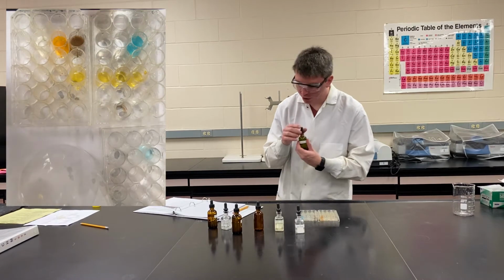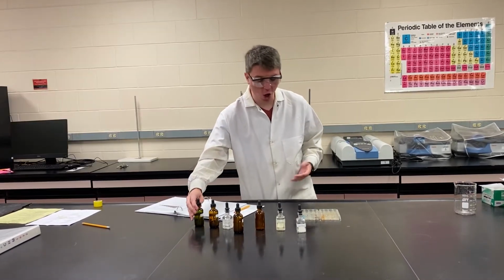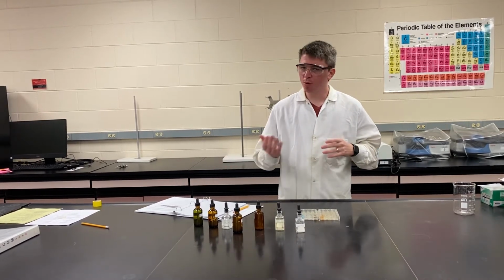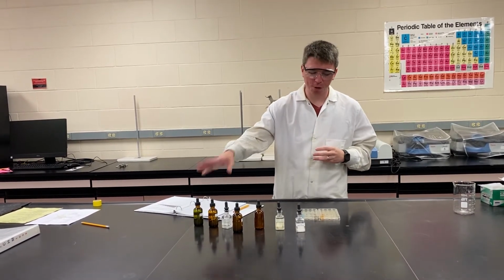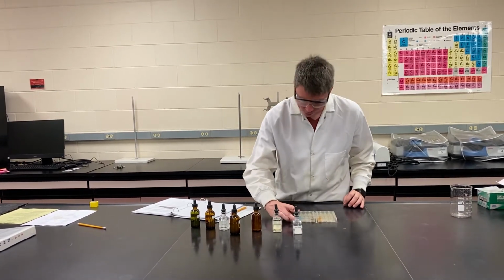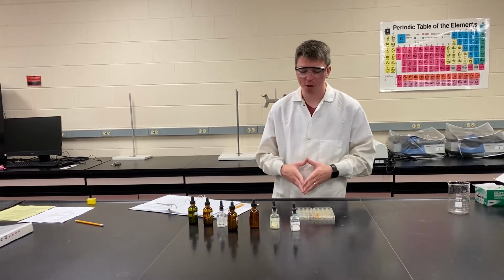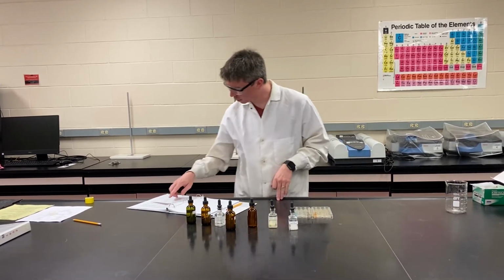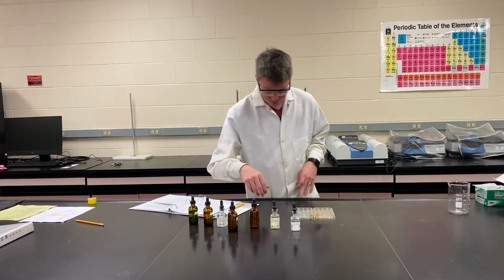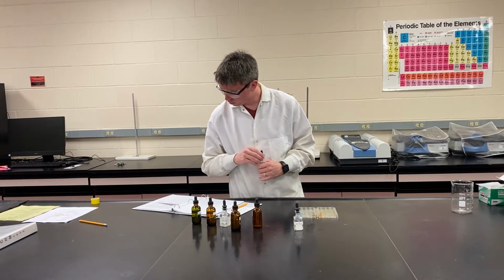Be careful, especially with the iron chloride and copper nitrate mixtures. Those solutions are colored inherently. So if it started clear blue and ends clear blue, then you don't actually get a reaction. But like we see in this one, it got cloudy in addition to now having that blue color, which does mean we have a chemical reaction. So now that we've completed our first set, we'll just keep moving down the column, filling in all of the mixtures that we need.